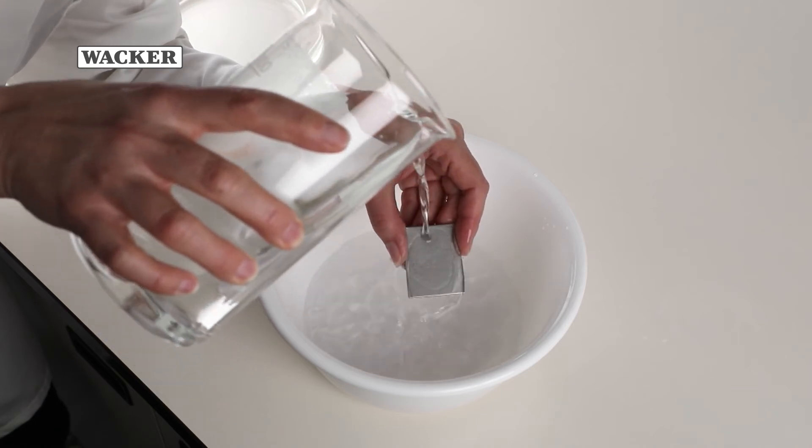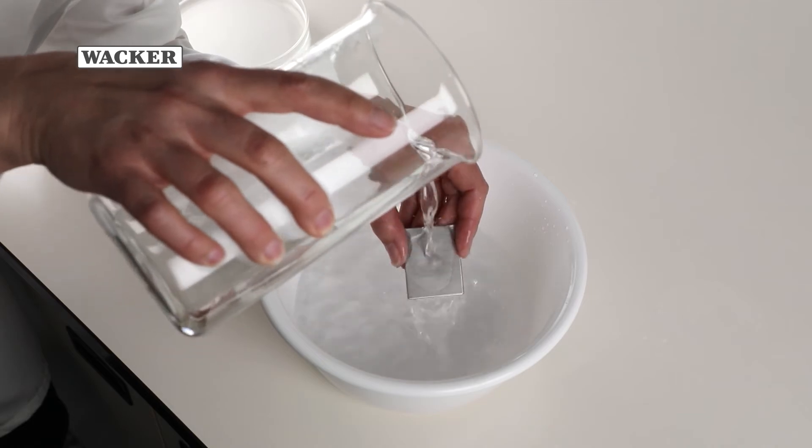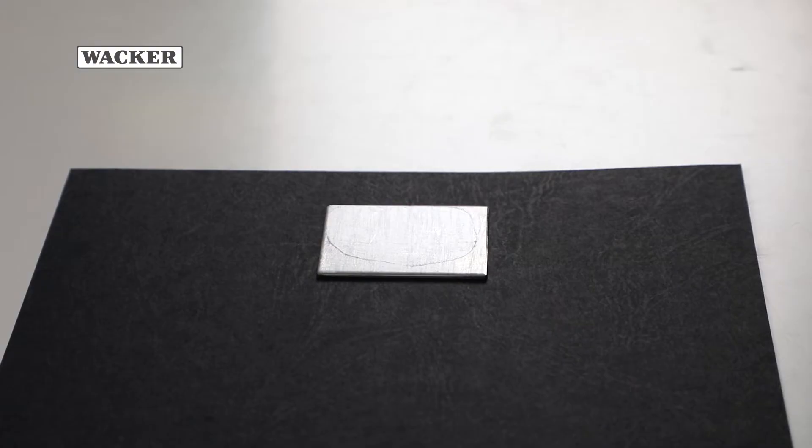Re-weigh the dried plate to determine the amount of material removed with the tap water. If a significant amount of residue remains, repeat the process with warm tap water, 60 degrees Celsius, followed by an alkaline cleaning solution.